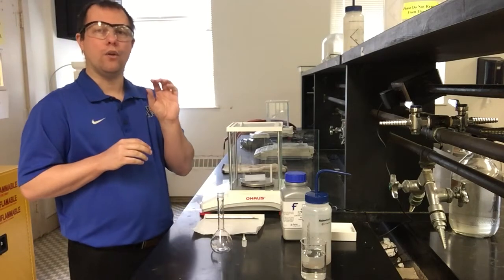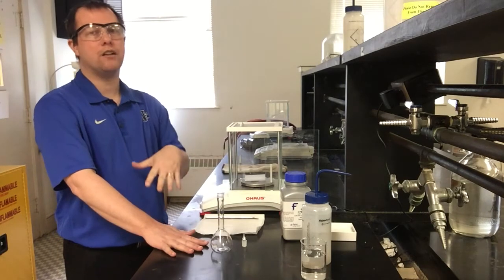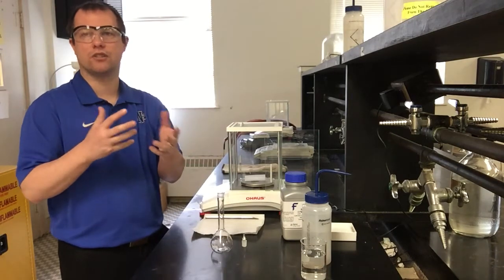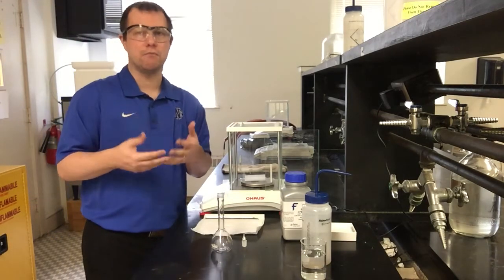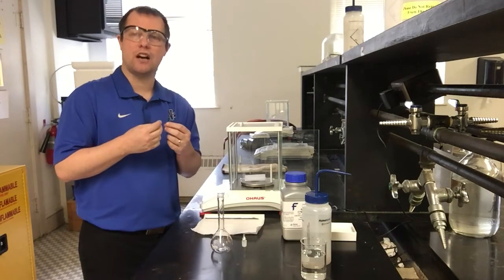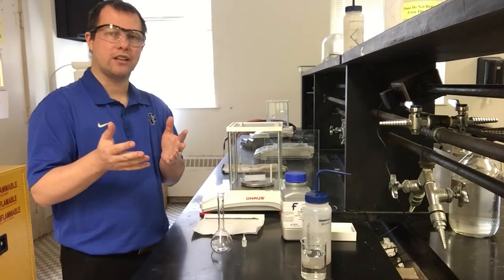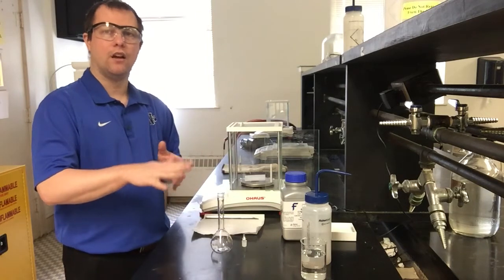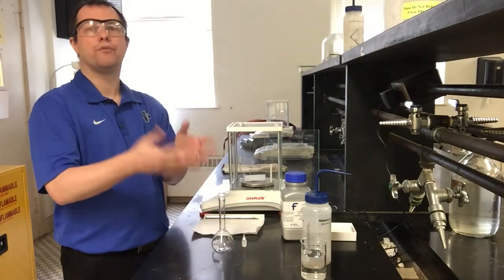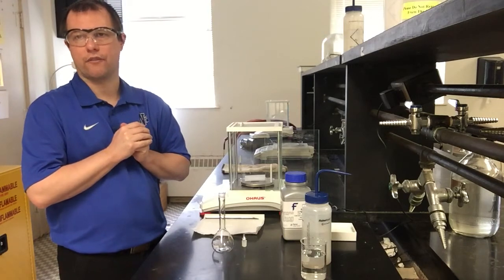And so our goal now is to add all of our solid to our volumetric flask, but we're not going to immediately fill it up to that line. We're going to fill it up maybe to the start of the neck part, but then we're going to mix everything up and get our solution nice and dissolved, and very thoroughly and evenly mixed all the way throughout, and then we'll go ahead and fill the liquid level. Because it is possible when you dissolve a solid in a liquid that sometimes the volume of that solution can be altered a little bit. And so that's what we're going to take into account by not filling it all the way to that line immediately. We'll add our solid here, fill our liquid up to maybe, like I said, the start of the neck. Then we'll mix it all up really good. Then we'll add the last little bit of water to get exactly that right volume that we want for the volumetric flask.